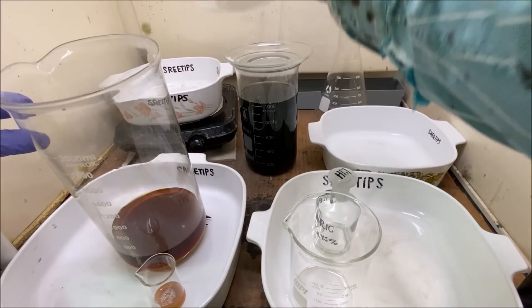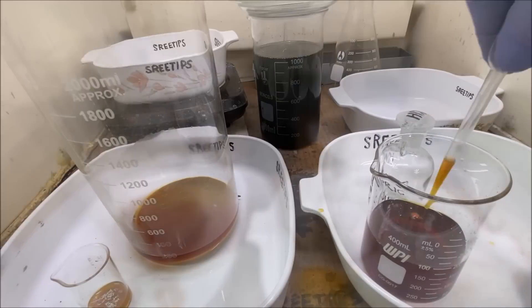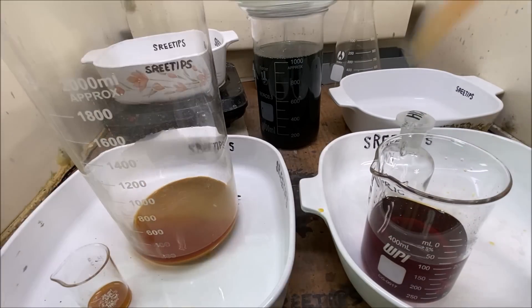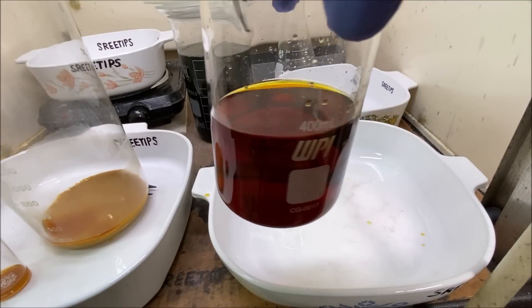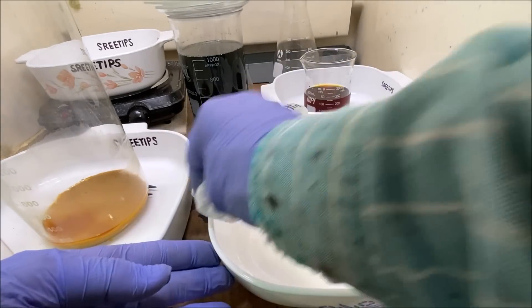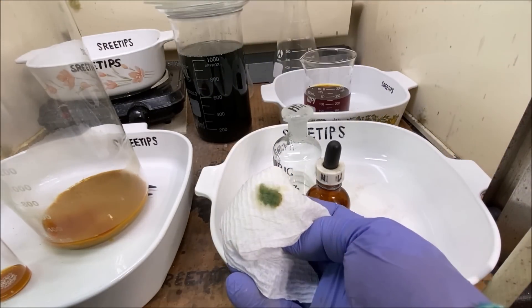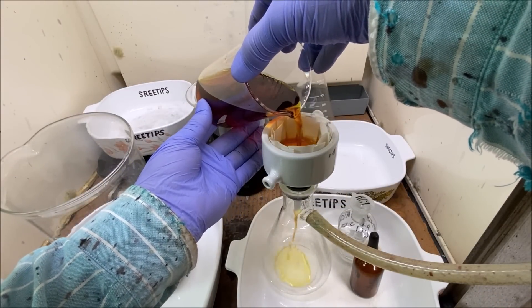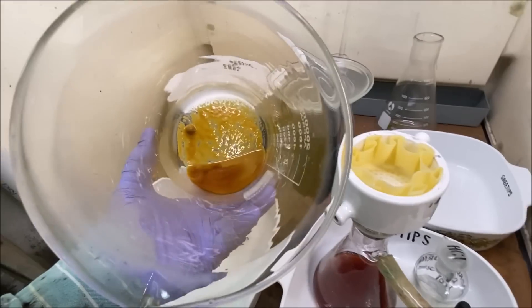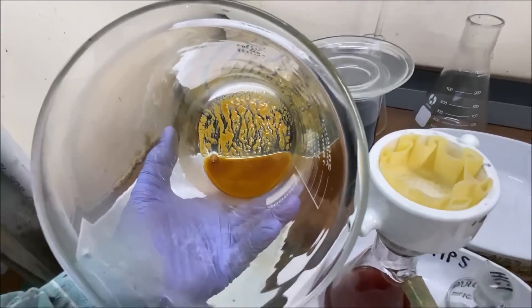I'll use a transfer pipette and pull the remaining settled clear solution off of those solids in the bottom of the beaker — just going to use a transfer pipette and get everything into a single beaker so that we can get at those solids to filter them out. Here's our nice clear solution — we'll set that off to the back, wipe up these little spills, and test it with stannous chloride. You can see we've got a nice green color which indicates palladium in solution. Now we'll pour the solution we just drew off through a filter and capture the solids in the filter.